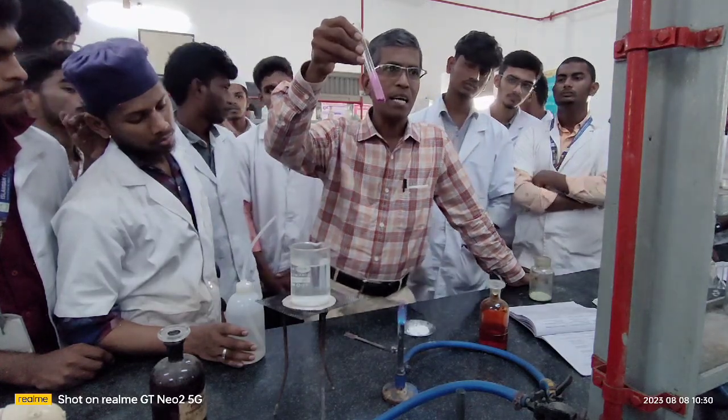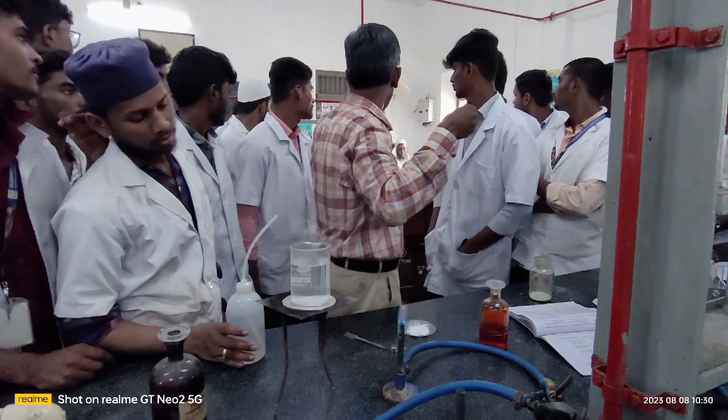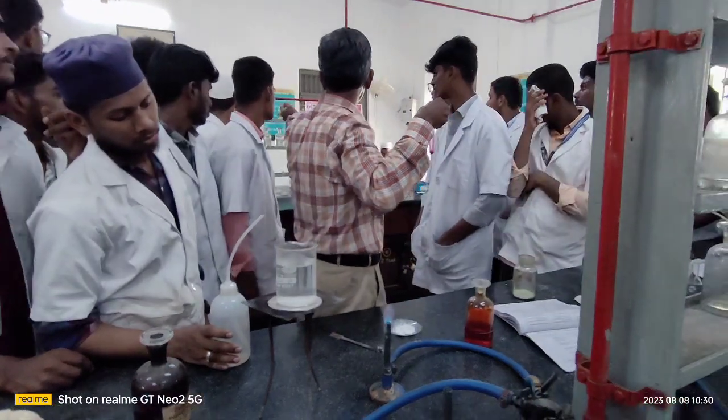I will show you one unsaturated compound. Baba, cinnamic acid, please. Cinnamic acid.